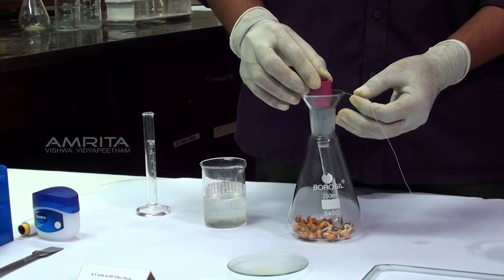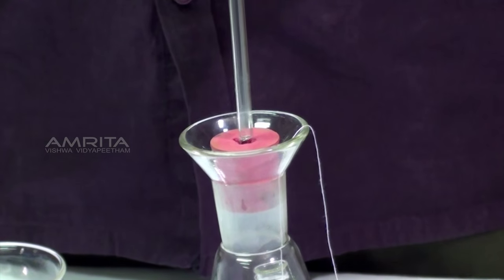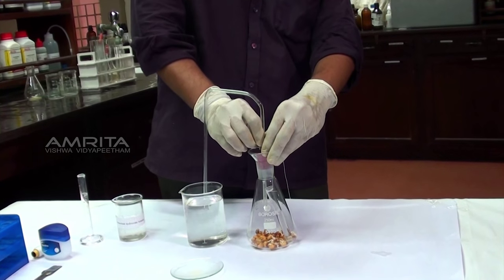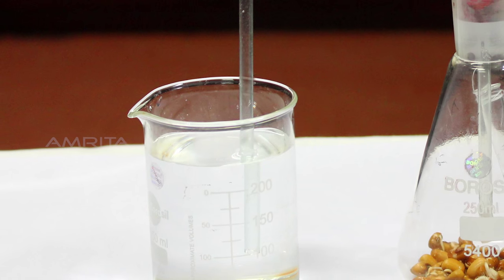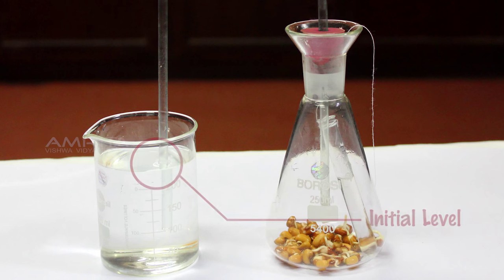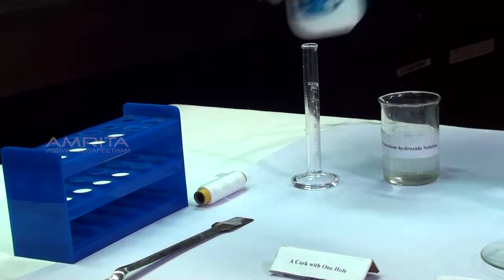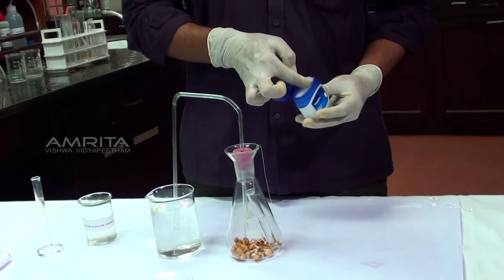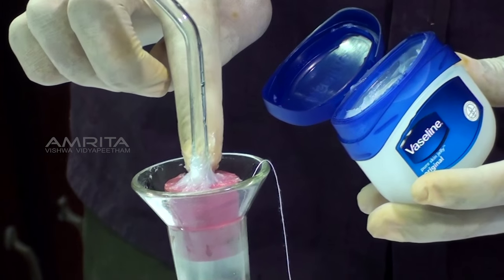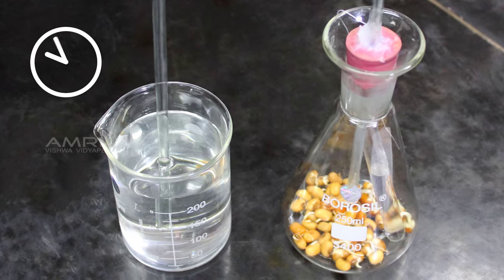Close the mouth of the conical flask with a cork. Insert one end of a delivery tube into the conical flask through the cork and dip the other end in a beaker containing water. Observe the position of the water level in the delivery tube — this is the initial reading. Use your finger to take some petroleum jelly and apply it on the cork to make the apparatus airtight. Keep the apparatus undisturbed for two hours.